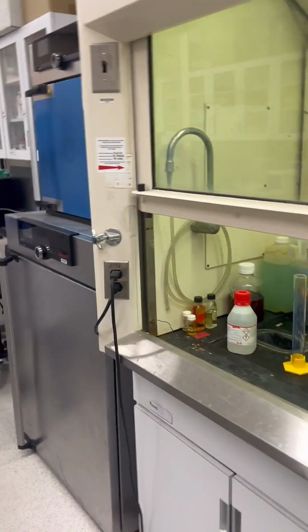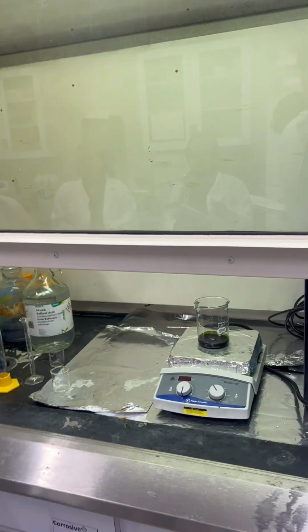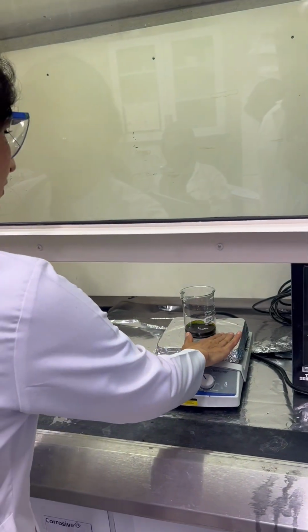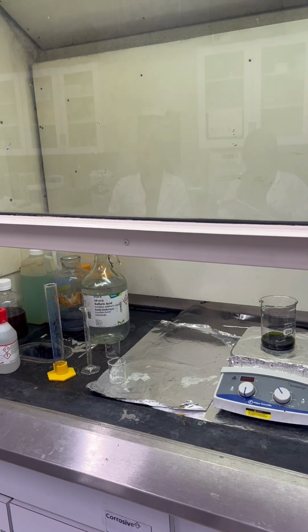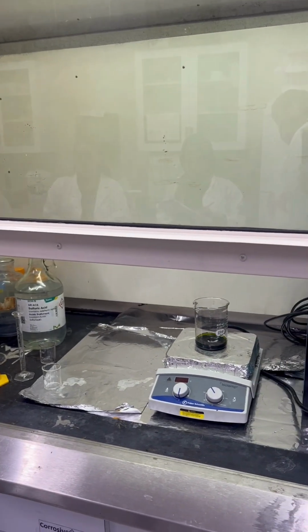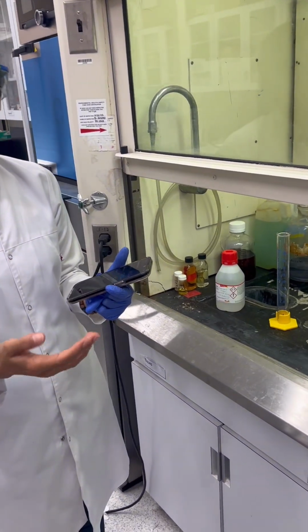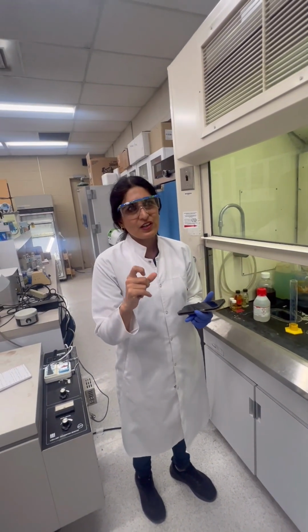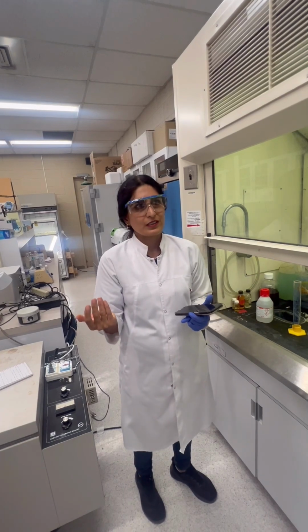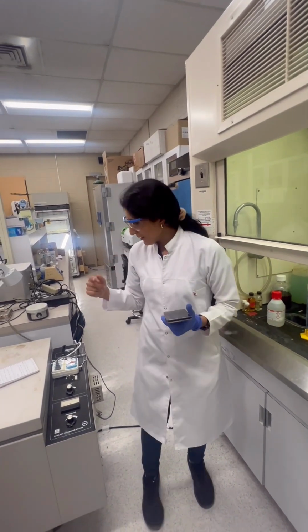So for 6 hours, will it dry out or not? No, it will not. The temperature is off. Just wash and dry it. After 6 hours, we wash 3 times with a mixture of HCl and water. Okay. And after that... What is the ratio of the mixture?